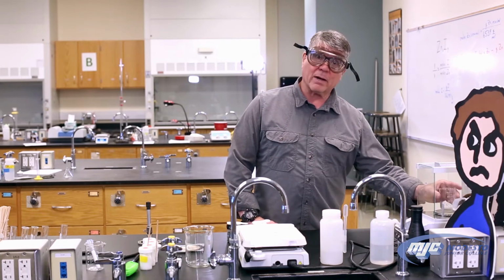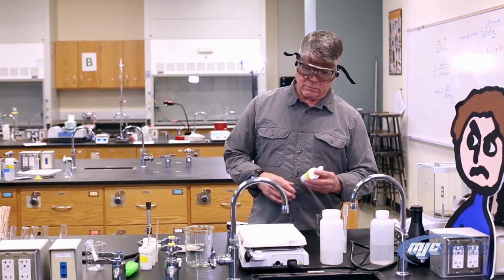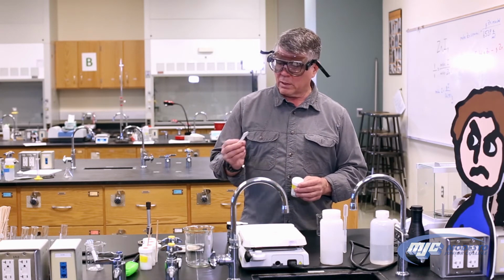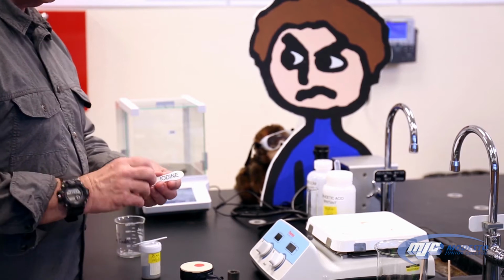So we take the beaker out, making sure not to touch any buttons. We're going to add about 1.2 grams of zinc first. Now, a couple things about adding these reagents. Matt will have some spoons out. He has what that spoon is for on it. This one has zinc. This one is for iodine.